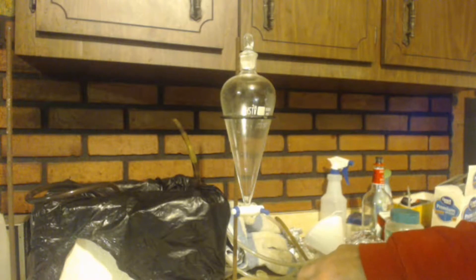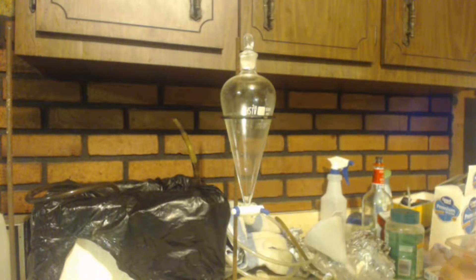Then you take your ether layer and you put some calcium chloride or magnesium sulfate or something in there to soak up all the water. Then you can decant it off. And you got all the water out of there.